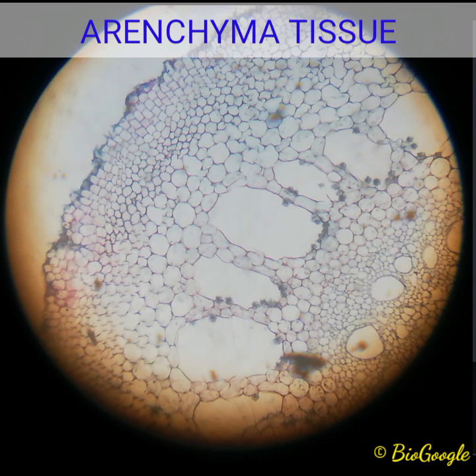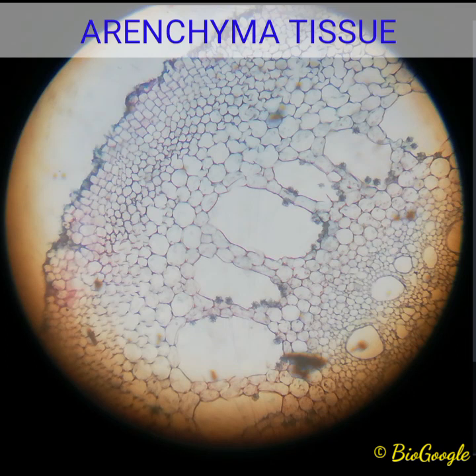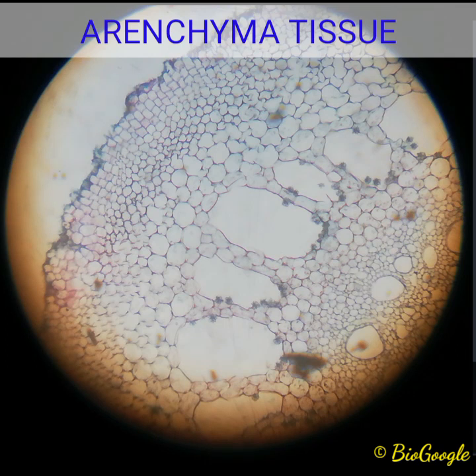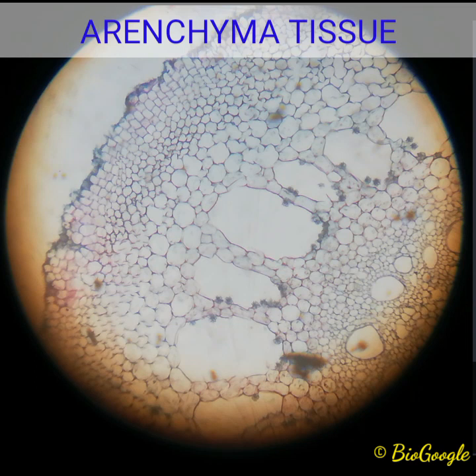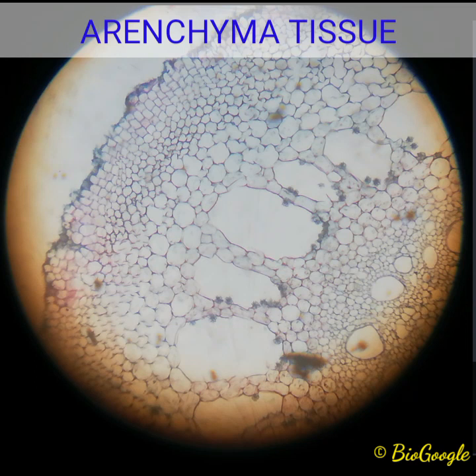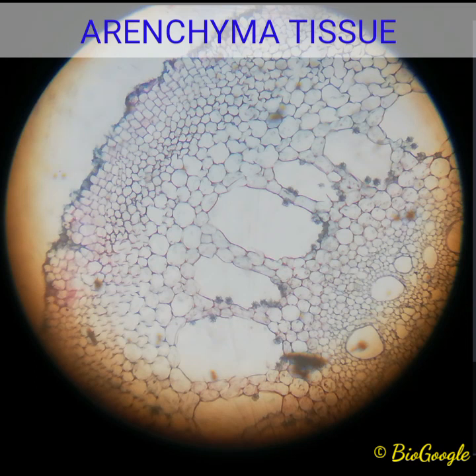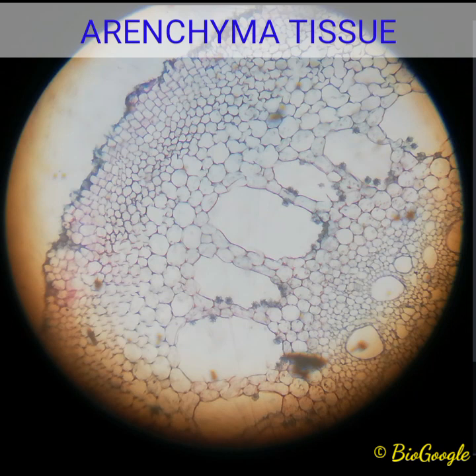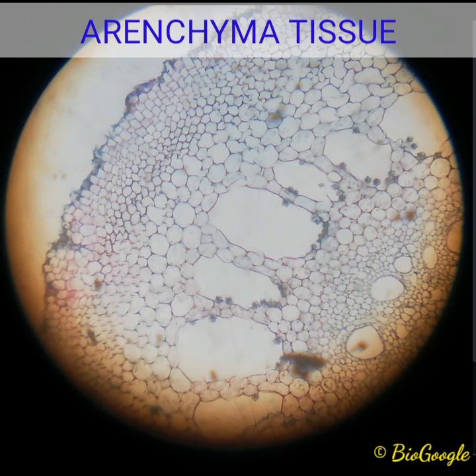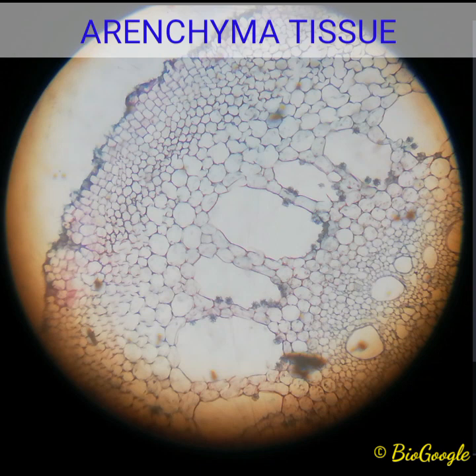Remember, aerenchyma tissue is a type of parenchyma tissue — a type of parenchyma that stores air bubbles or air spaces. It is present only in aquatic plants, especially those that need buoyancy to float on the water surface.